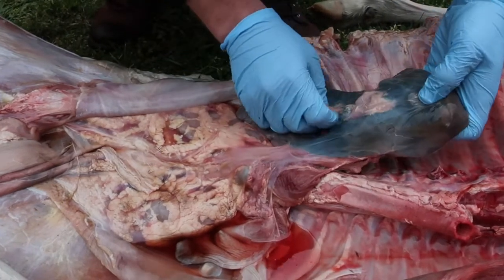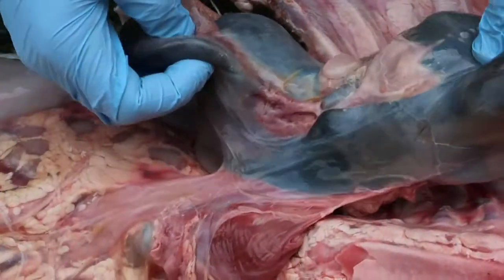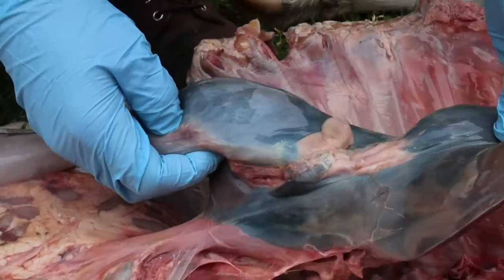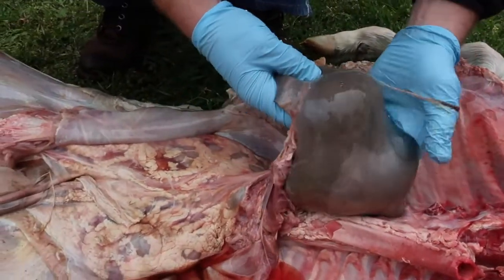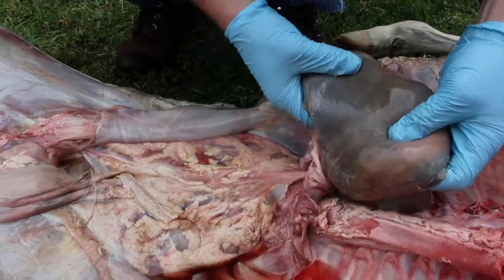And underneath here we have the gallbladder, and the gallbladder contains bile, and that bile is produced by the liver. It helps to break up some of the lipid that ends up in the digestive material that goes into the small intestine. The liver is also really important for many functions, but very important for storing glucose for energy, and also producing glucose for energy.